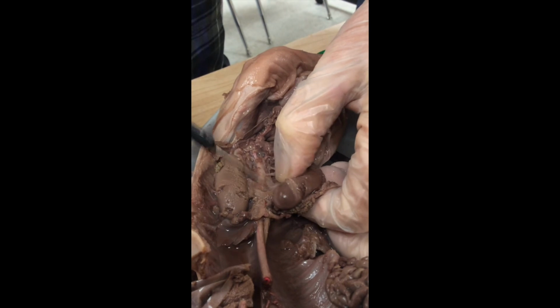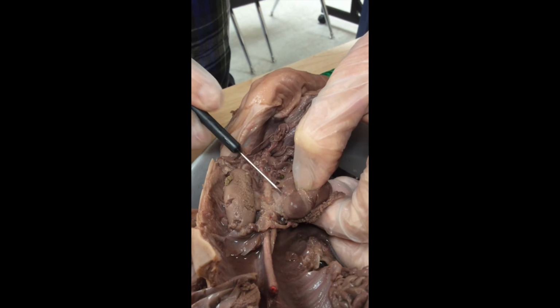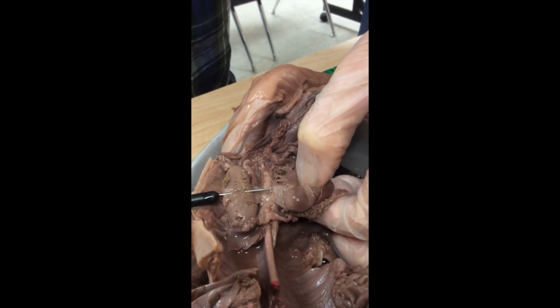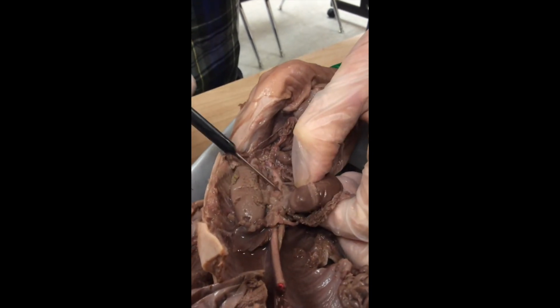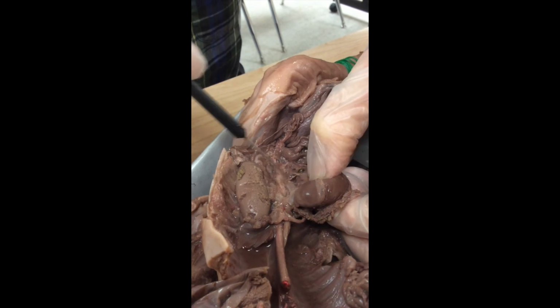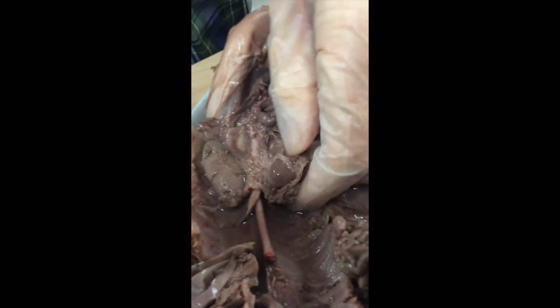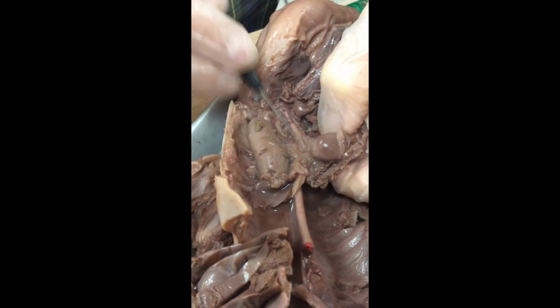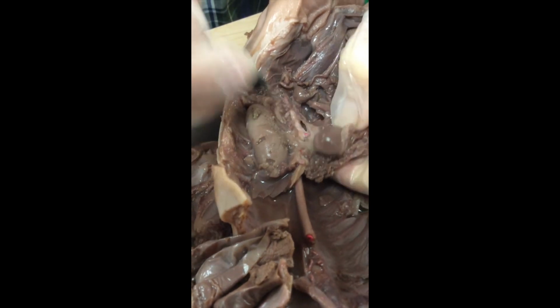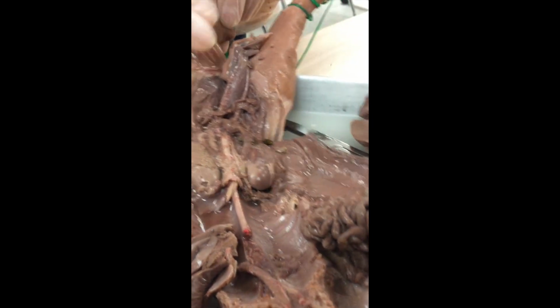You can see it merged with the aorta. There's the renal vein going in right there. We see the inferior vena cava right there. And I don't know, where's that ureter? It's a little bit fragile. I don't know if I'm going to detect the ureter for y'all. Looks like I'm not. Okay, so we have the kidneys right there.